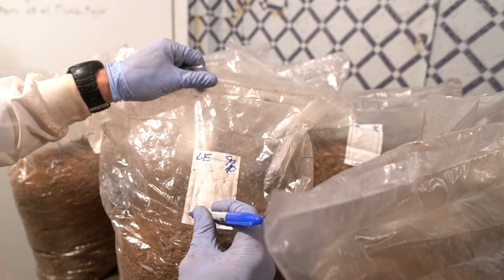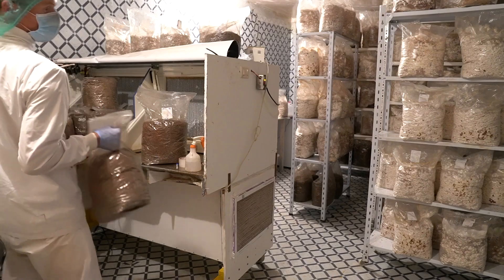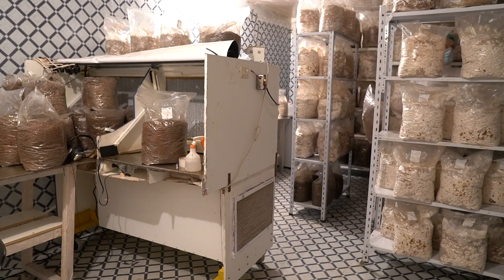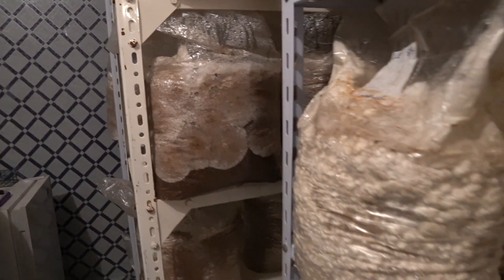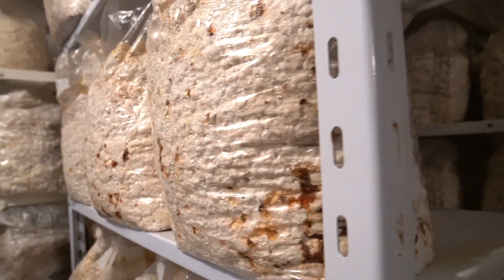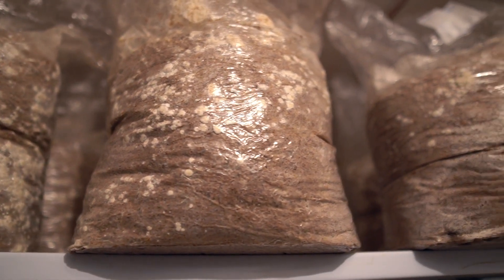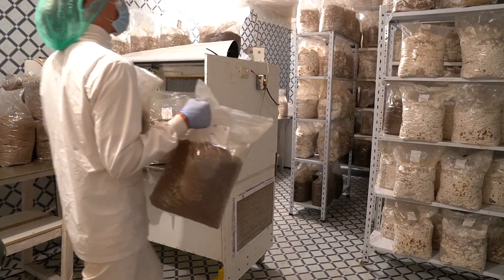Labeling is obviously extremely important. Dating is very important. I use the Latin name — Lentinula edodes — for shiitake, like most mushroom growers. Then find a home for them on the shelves. Here are some different stages of growth — you can see different blistering. Check out my video on Patreon that goes into more of the effects of light and vibration on shiitake blocks.